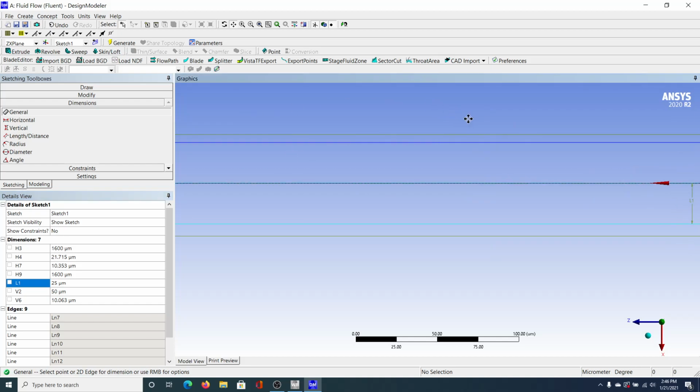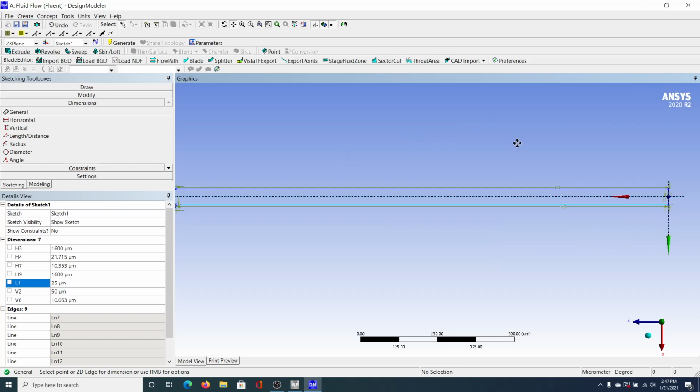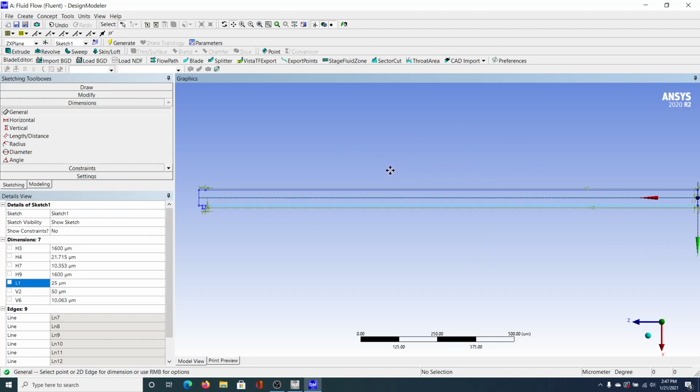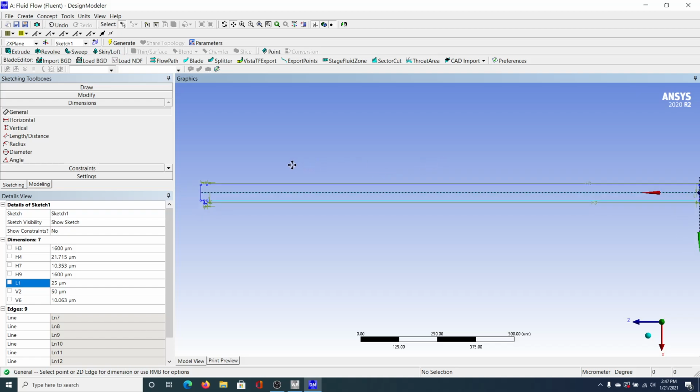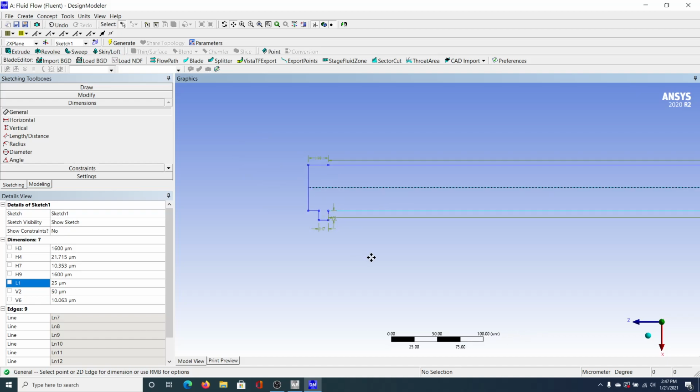I can go back and change those later if we determine that they are inaccurate from looking. Which, looking at it now, I think it's good. I don't think it was wider than that. Because I'm looking here at my notes. Basically, I have dimensions. I took a screenshot, but I'm just trying to match up which is which.